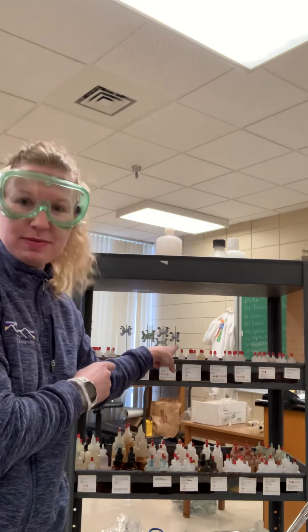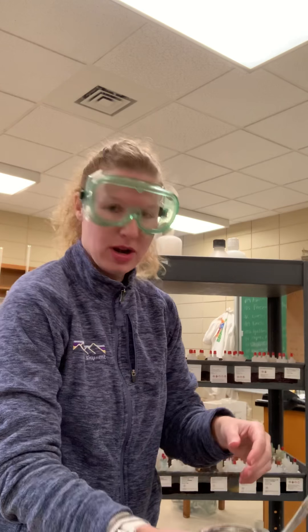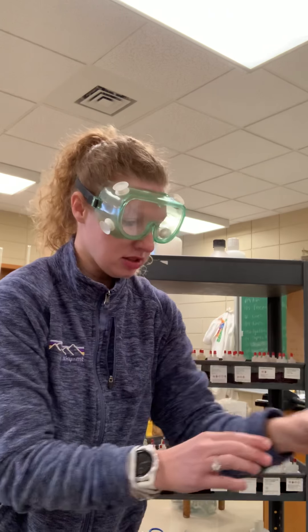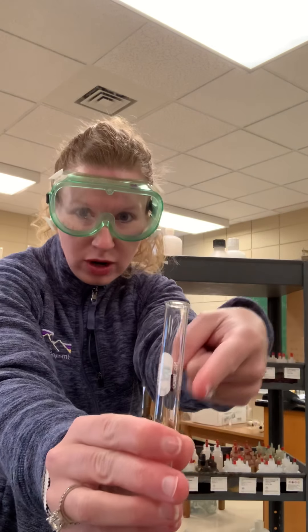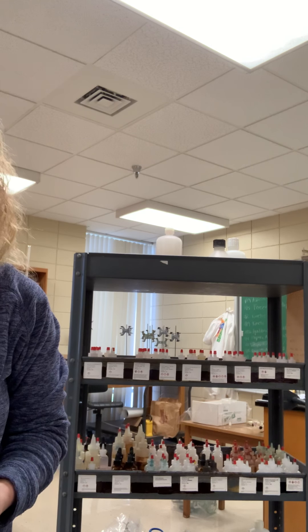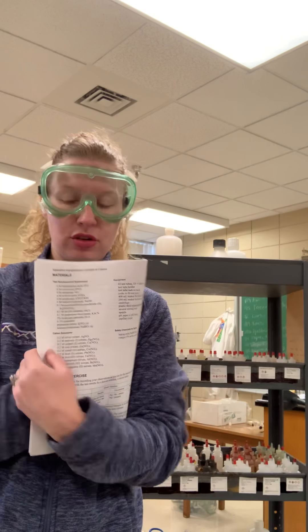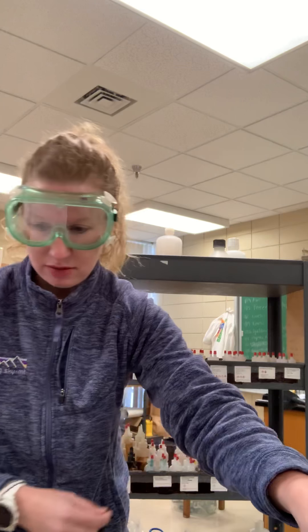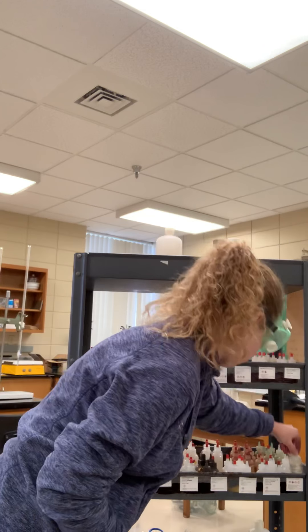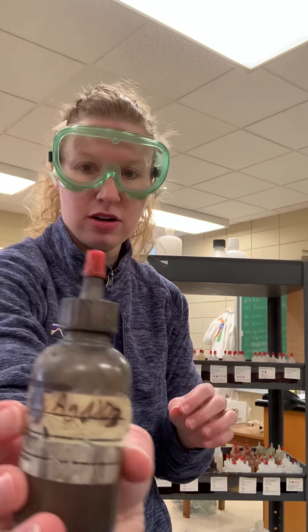Since I'm working in the lab by myself, I have everything right here that I need. I went ahead and pulled out all of these cations. My procedure says mix 3 drops of each ion that I'm going to be testing. So the ions I'm going to be testing are the cation solutions here, and I have them all lined up. The first one is silver nitrate — AgNO3.